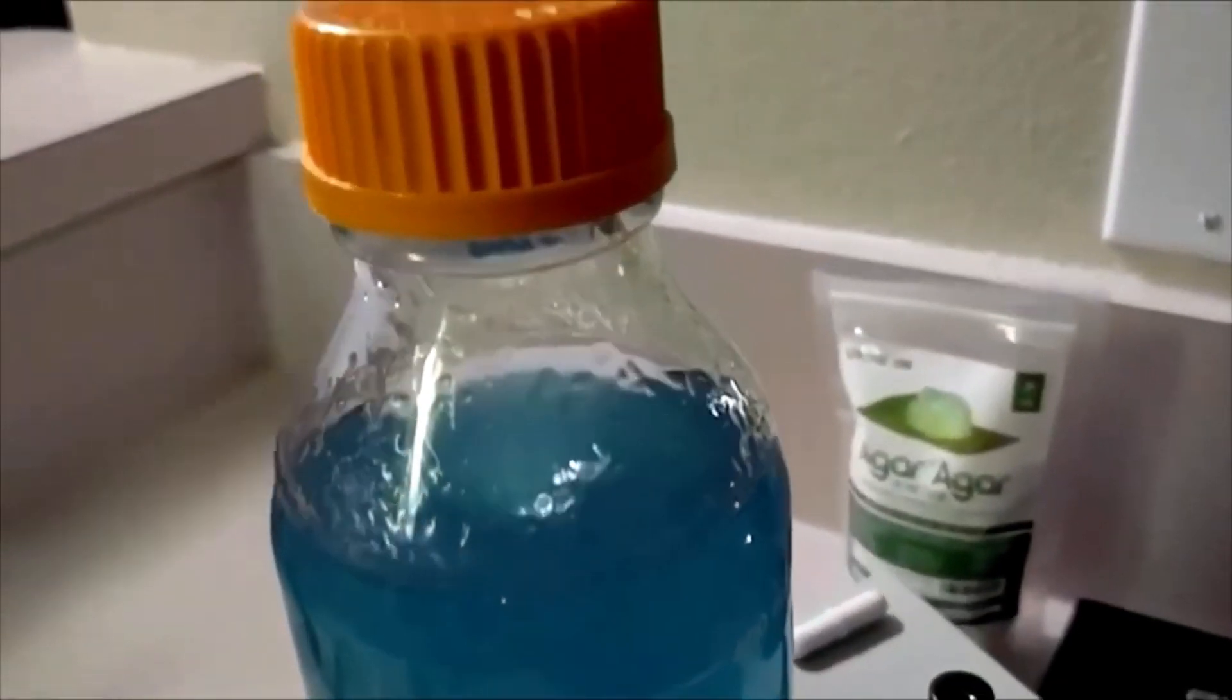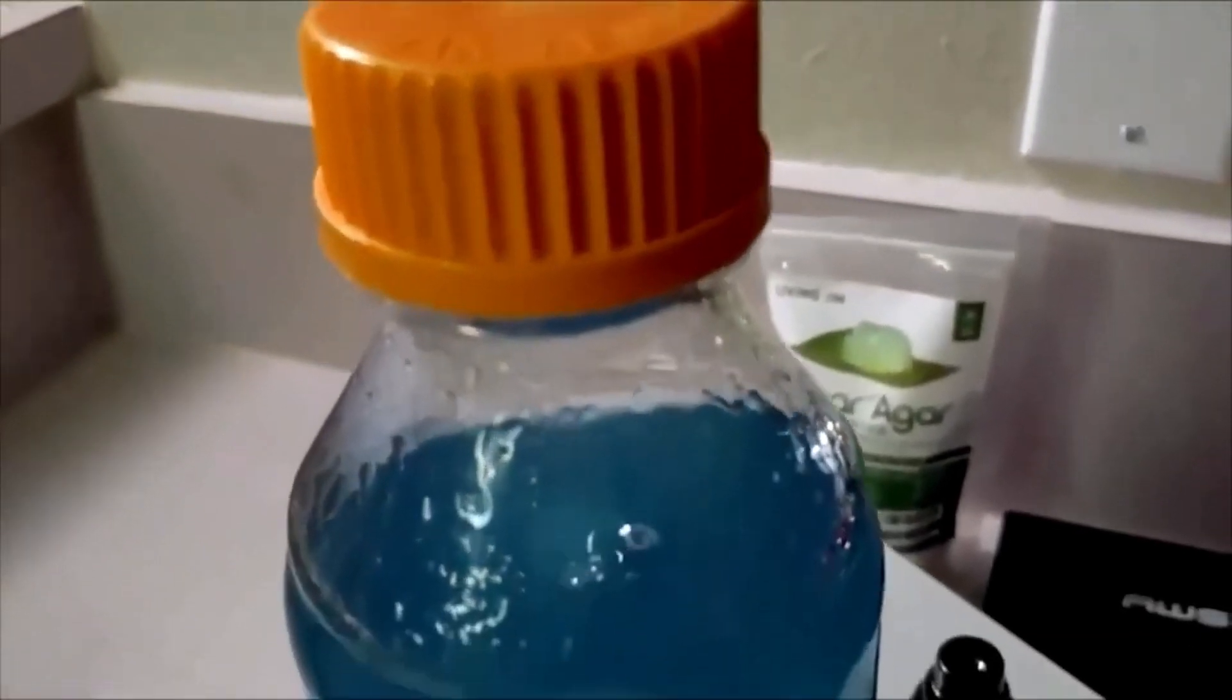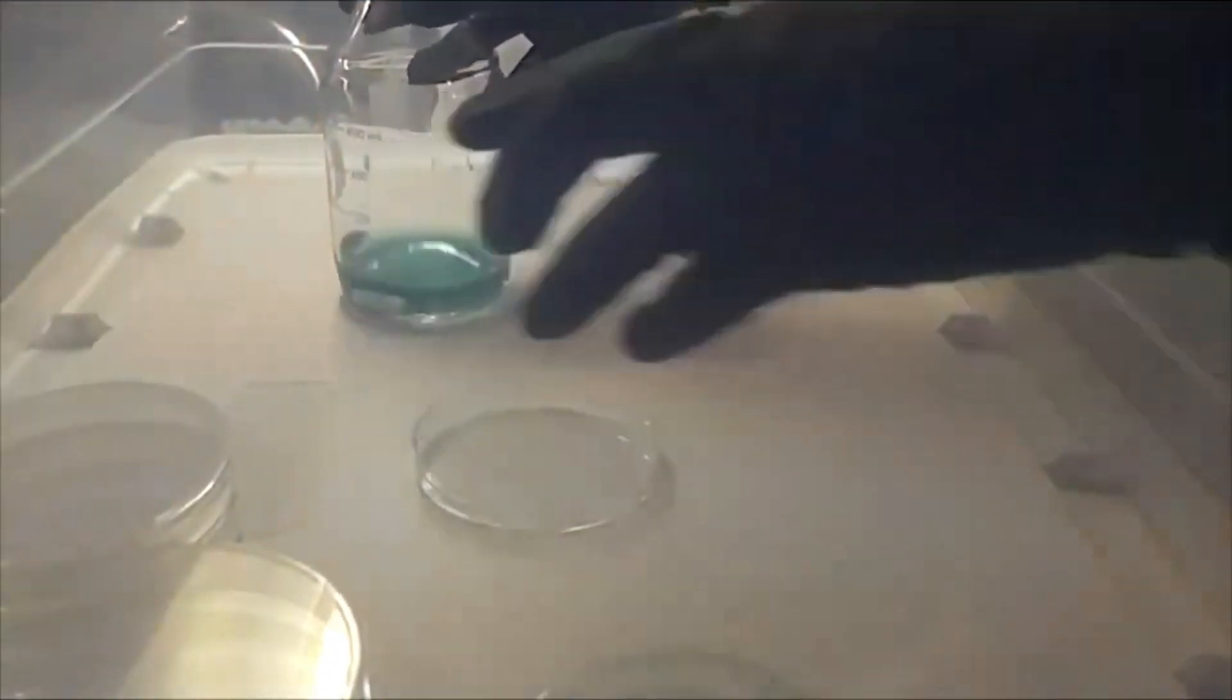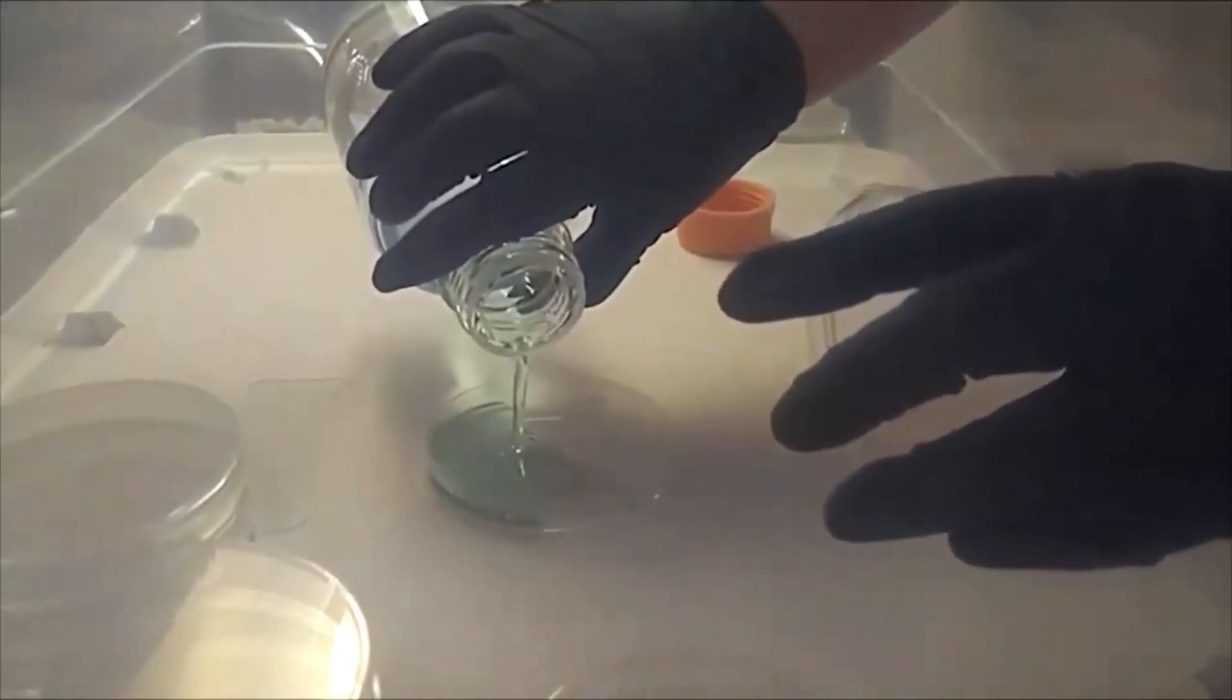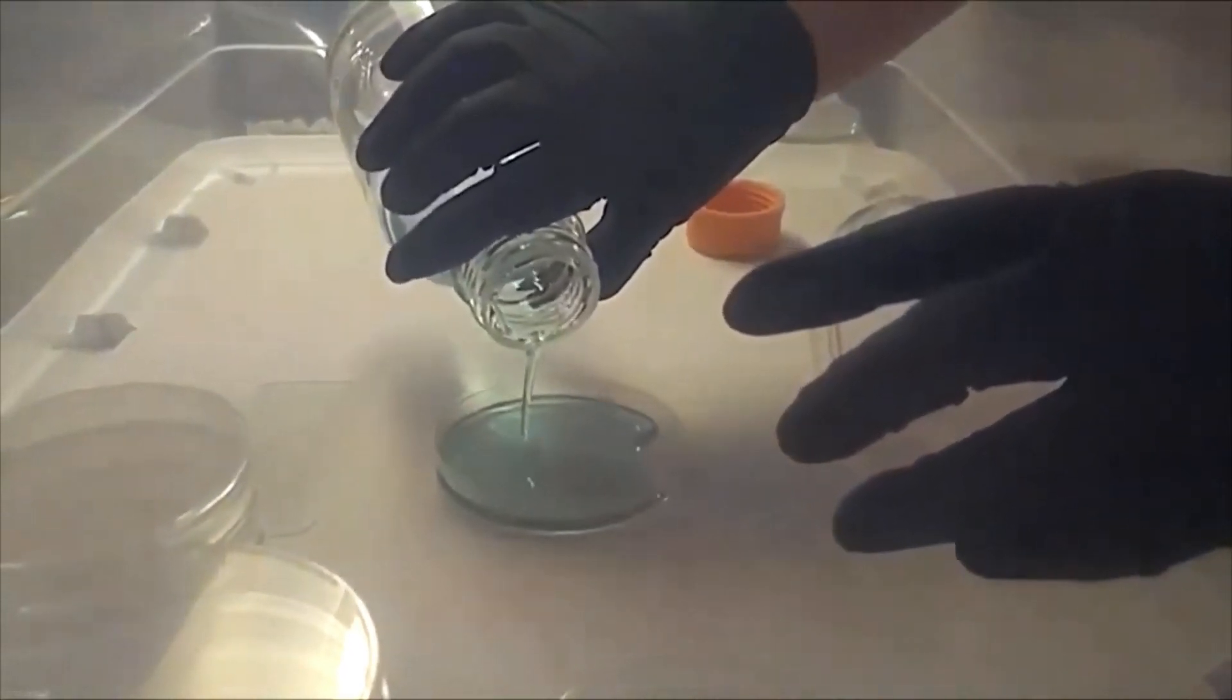Water agar has proven for us to be the best recipe when dealing with spores and clones. The idea behind water agar is to give just enough nutrients for the mycelium to branch out while giving very little nutrients for contamination to grow.